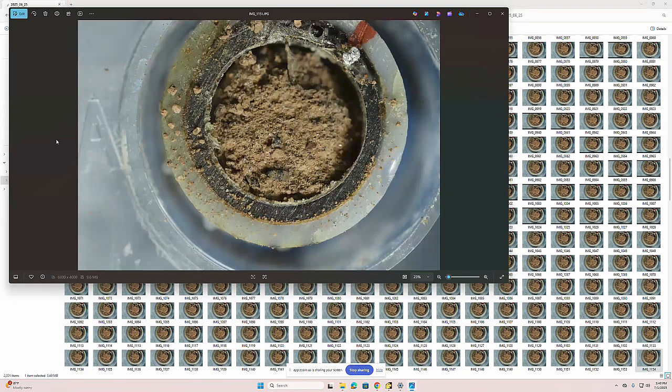What's really happening is you're getting too significant of an overlap per individual focal plane. So the focal plane is pretty long. Really, it looks like you could have captured a complete image in only three images here. That looks like where you're at. So can I just ask what lens is this? Do you know what the lens is?